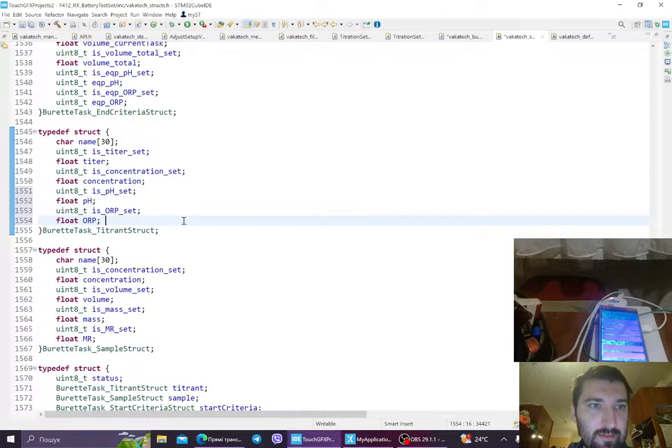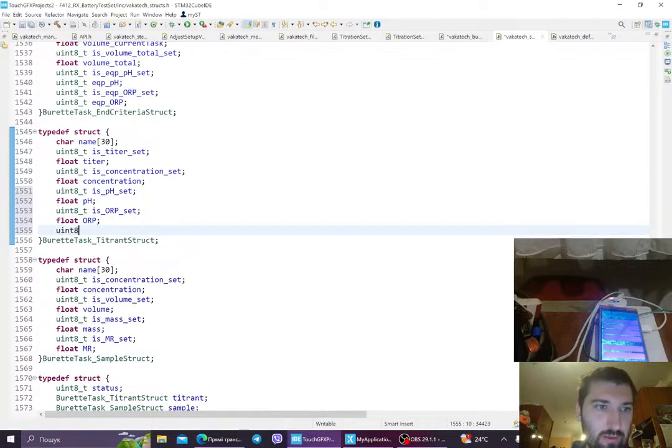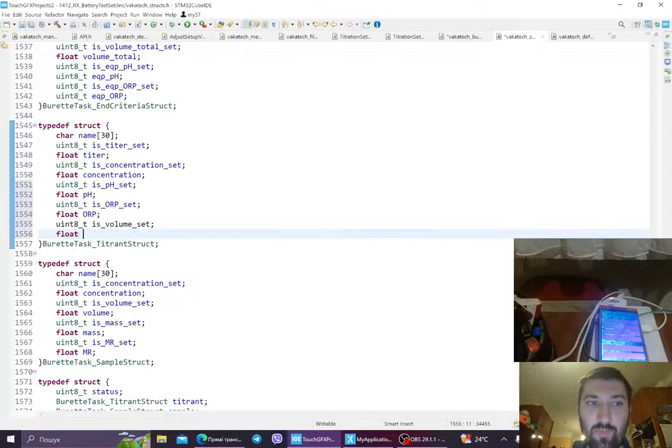Titrant has titer set, pH or ORP, and probably I would like also the volume set. So the max volume that there is.